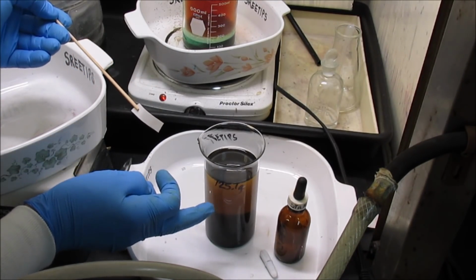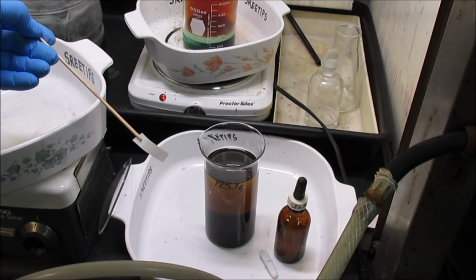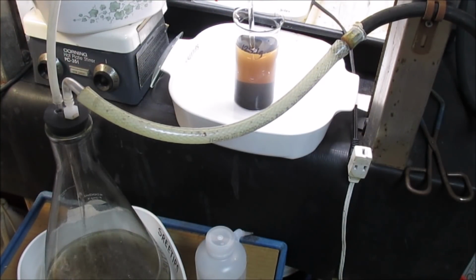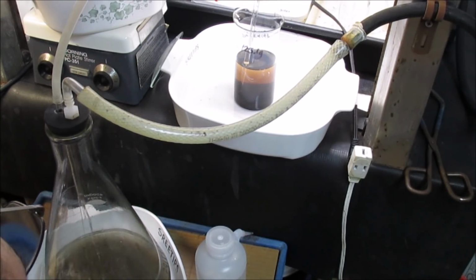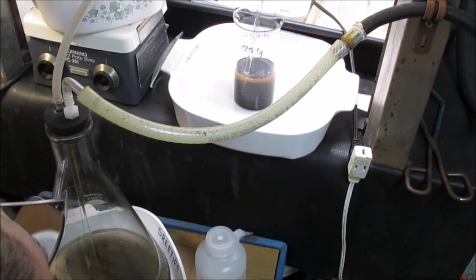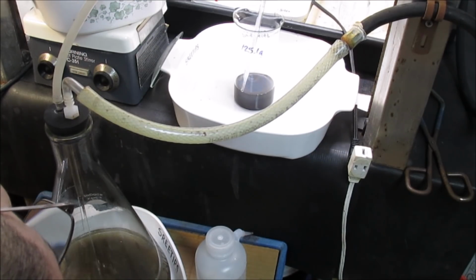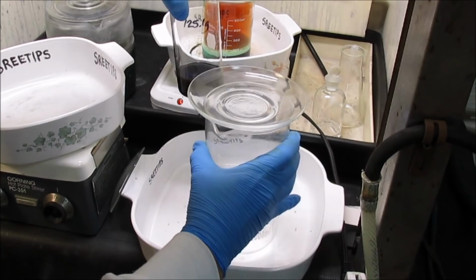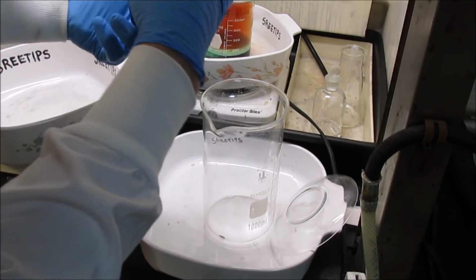I'm going to vacuum it off and get it off of the top of the black powders down at the bottom of the beaker now. Transfer the black powders back into this larger beaker now. And we'll start the hydrochloric acid boils.